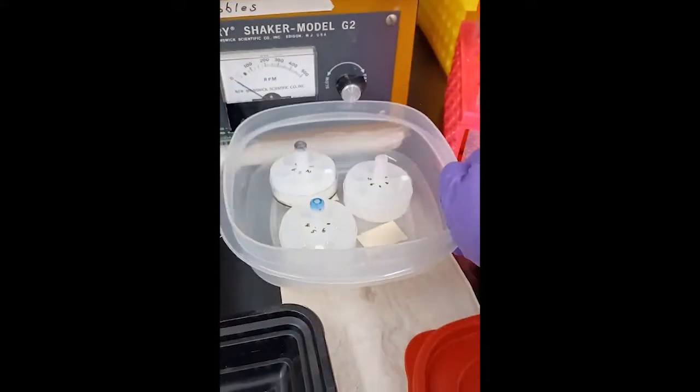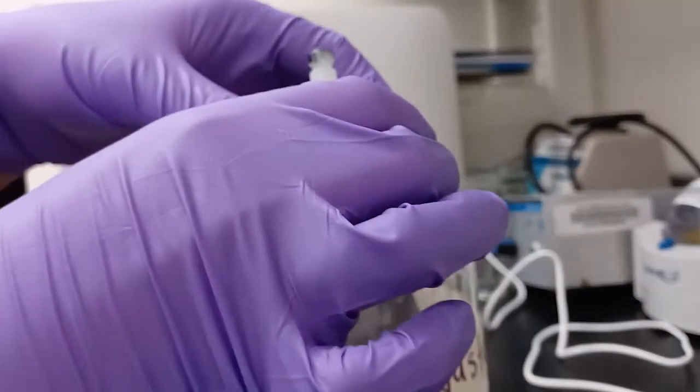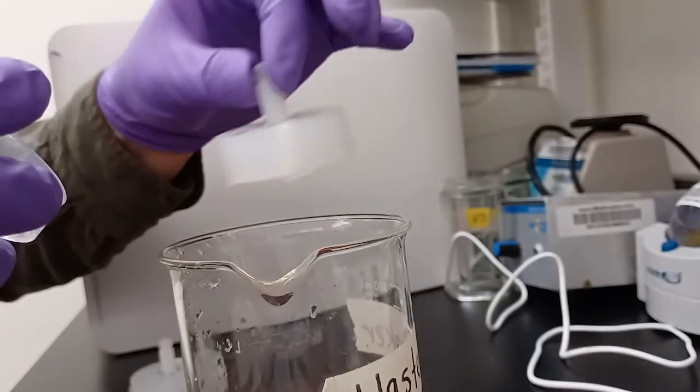Wait five minutes, then remove the netwells, take out the inserts, and discard the solution in the basins. Now, repeat this whole process once more.